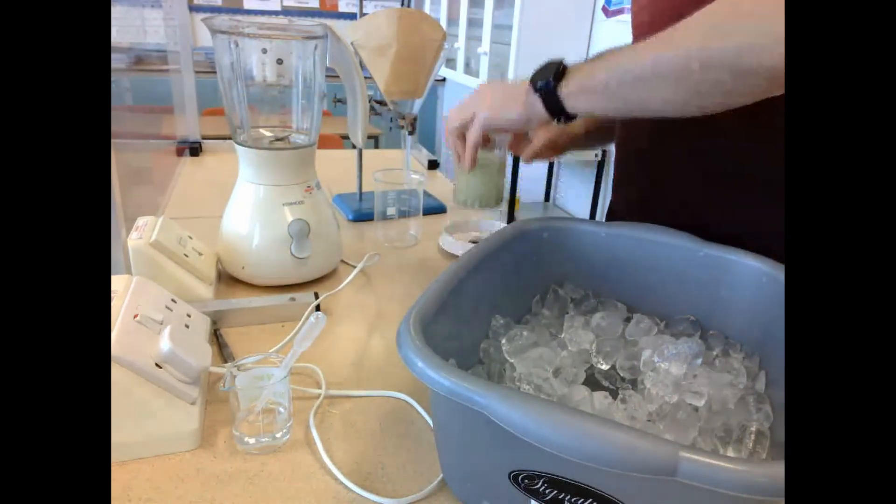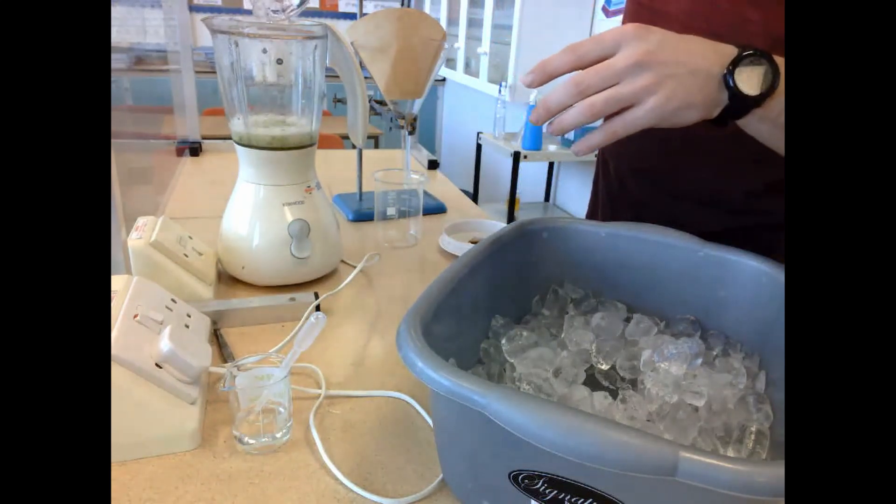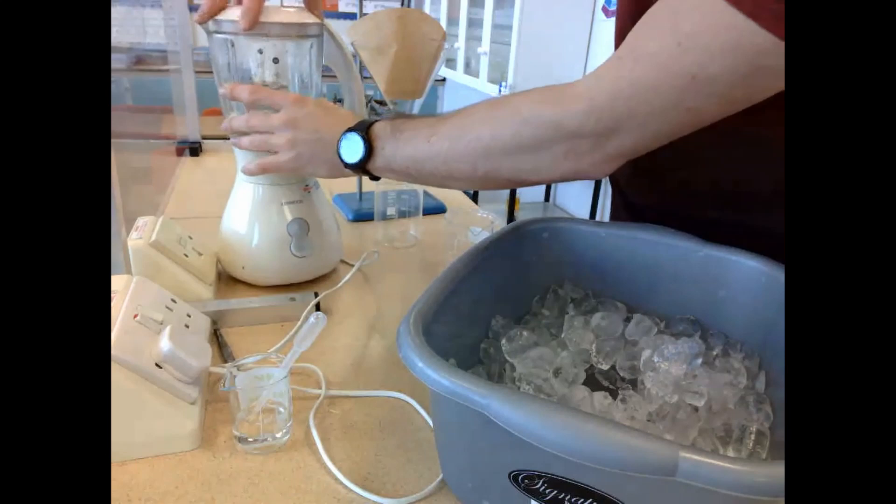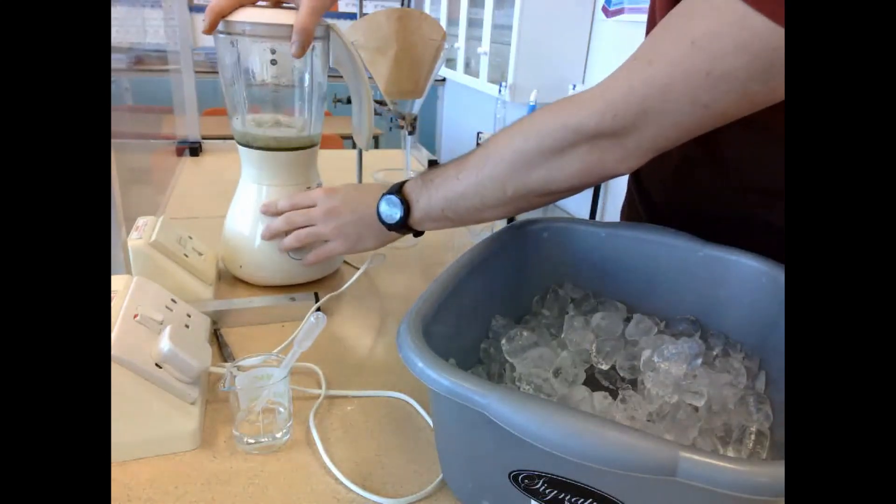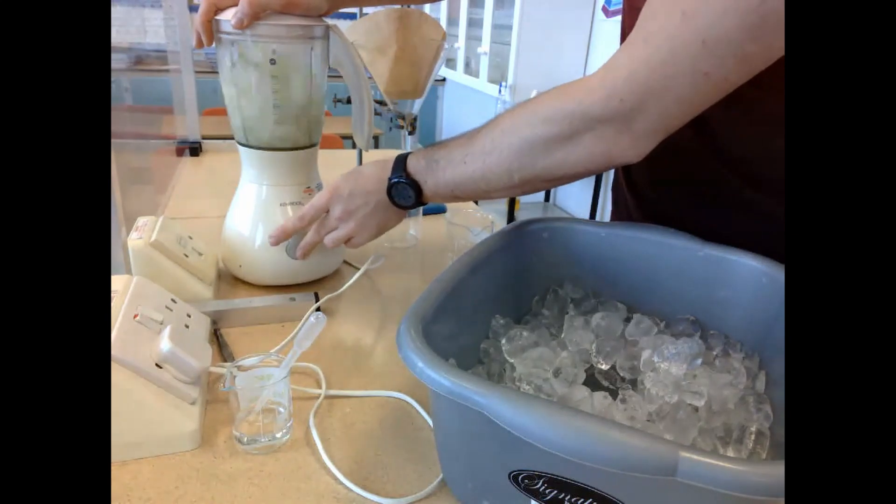Now we are going to blend this solution to break down any cell walls that are still present. And all we're going to do is blend it for three seconds because any longer than that would result in the DNA itself breaking down. So it's a very quick one, two, three.